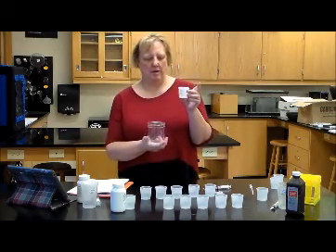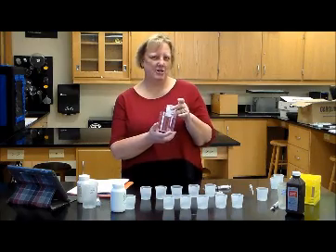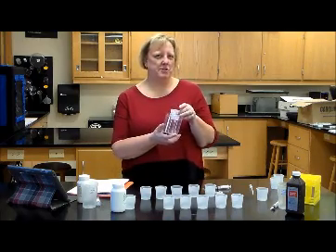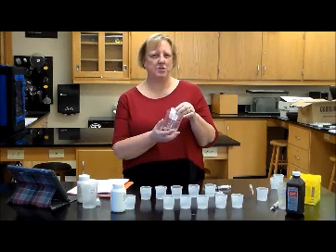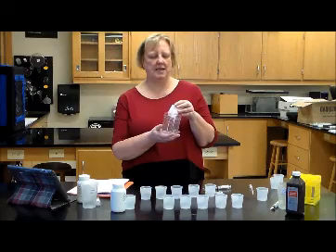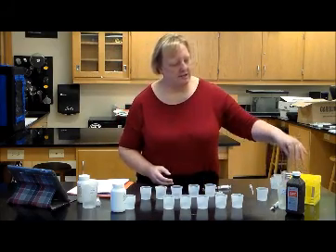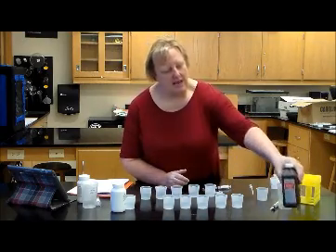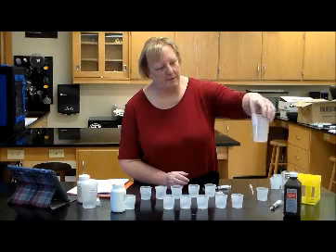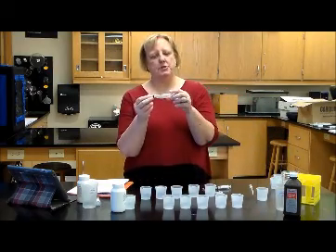Catalase will be in the smaller cup, and this larger container will have ice in it. Catalase denatures at room temperature, so you have to keep the catalase at the ice temperature all the time. Do not take the catalase out and let it warm up. Another component that you'll be using in this lab is hydrogen peroxide. Hydrogen peroxide will be in this cup. You'll also have a syringe that's labeled hydrogen peroxide.